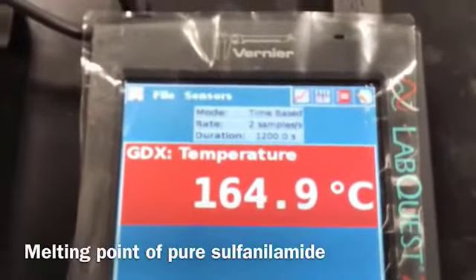Still melting. And it's melted completely. So these are the melted samples. The left one is the impure sulfanilamide and the right one is the pure sulfanilamide.